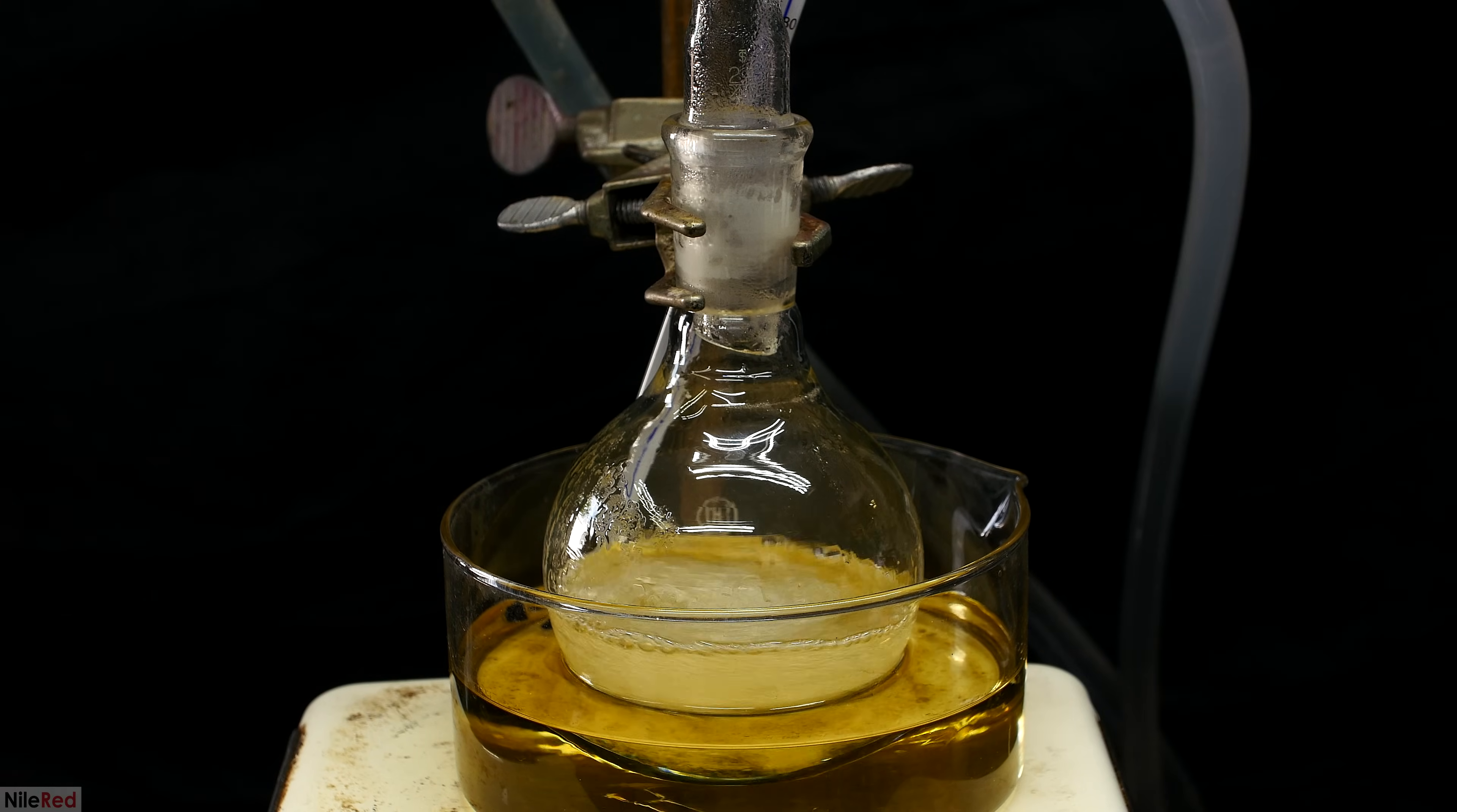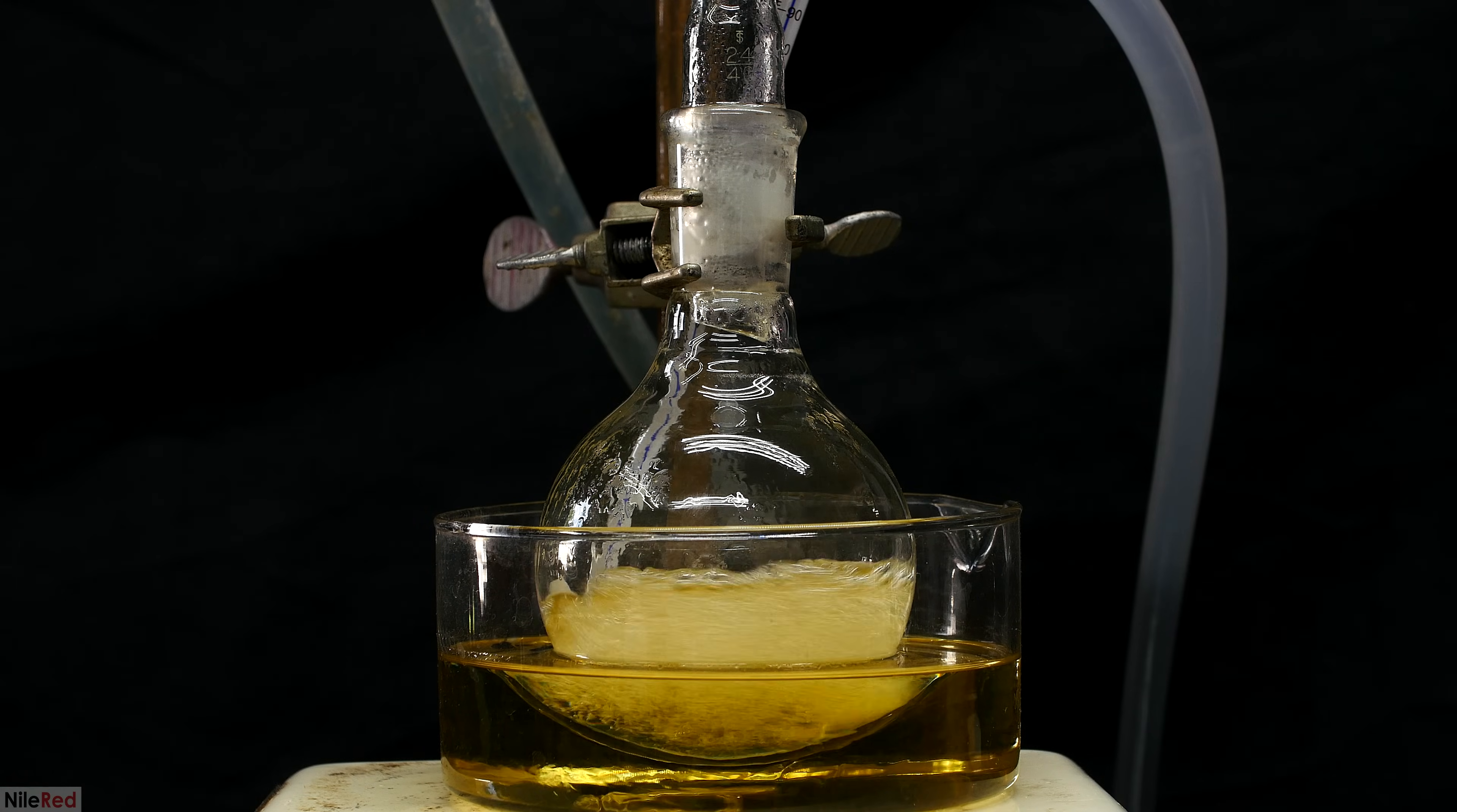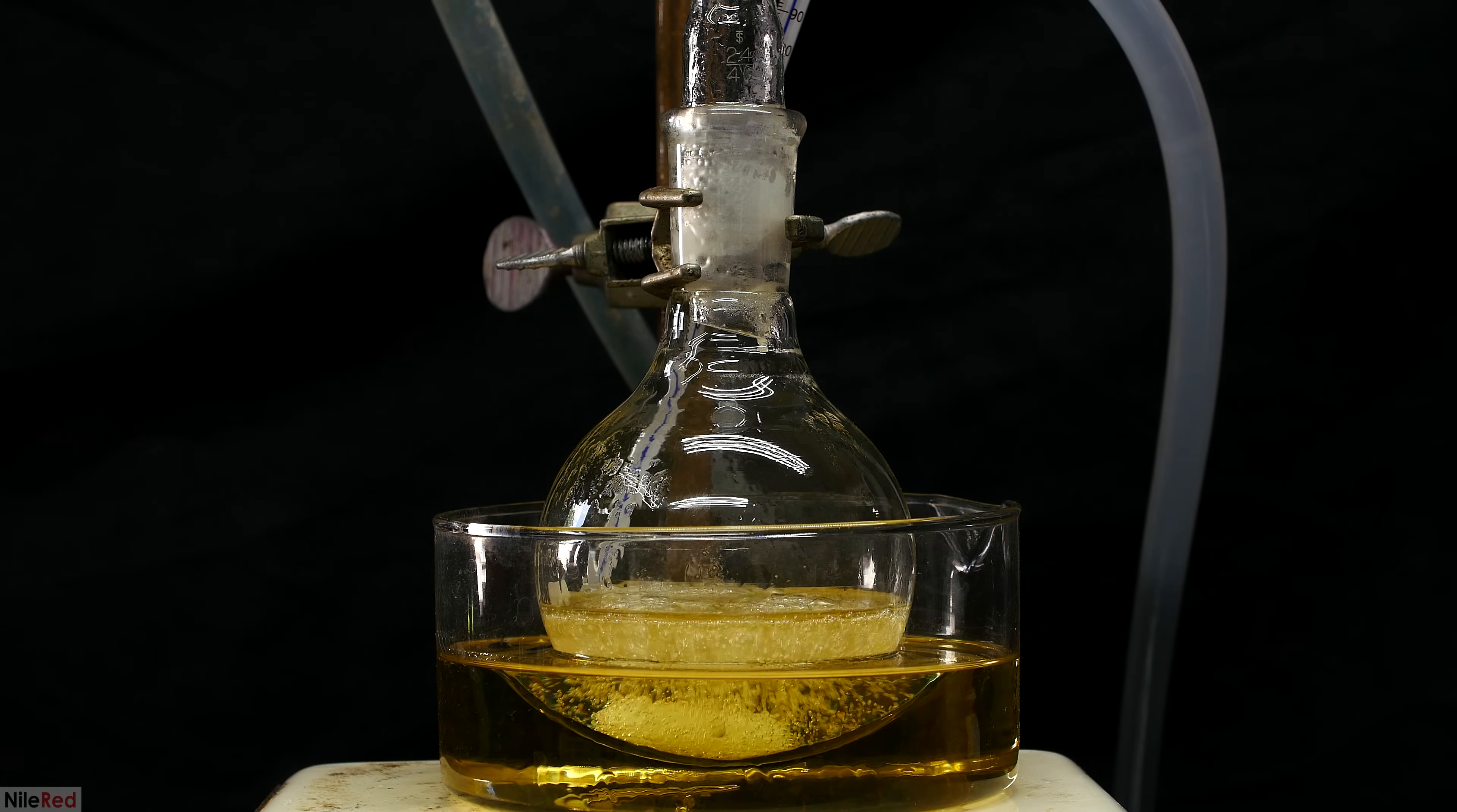As things get hotter and we get closer and closer to a reflux, the solution still looks opaque. This opaqueness, however, is not due to the presence of undissolved starting materials and it's actually CO2 gas. The stirring kind of increases the opaqueness of the solution, so I turned it off for a second just to show you guys all the bubbling.